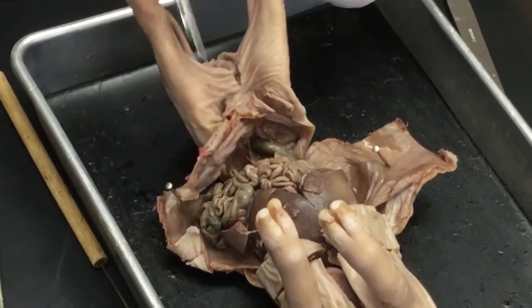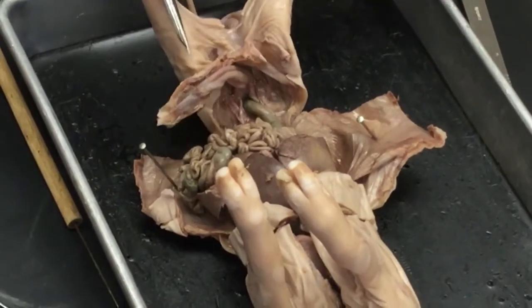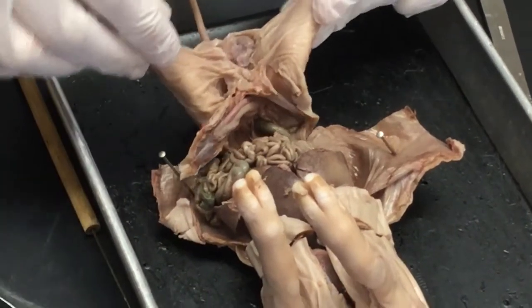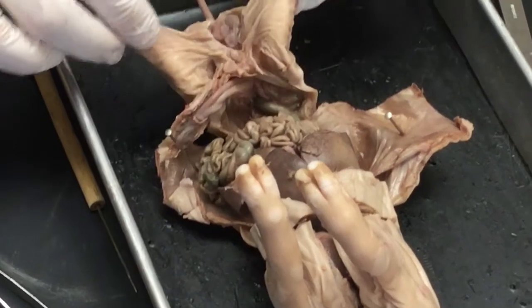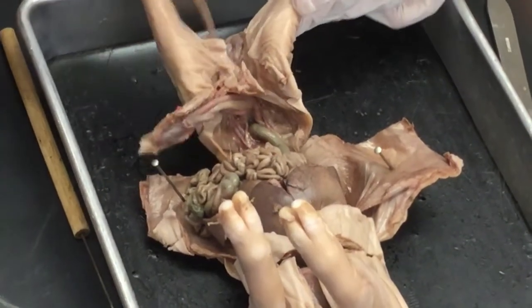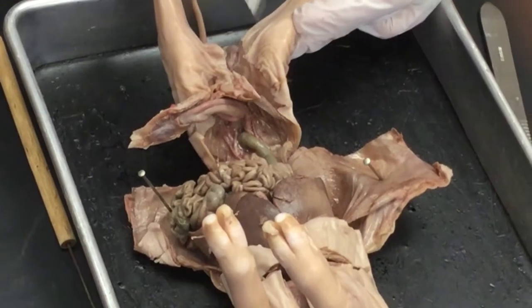So what I'm going to do at this moment is continue to cut my skin, and I can see that there's a little bit of film there, again, some connective tissue, and I'm going to continue to open that up so you can see what that looks like, and I'm going to cut over to the side, and so basically through skin, but not through anything that looks like it could be a structure.